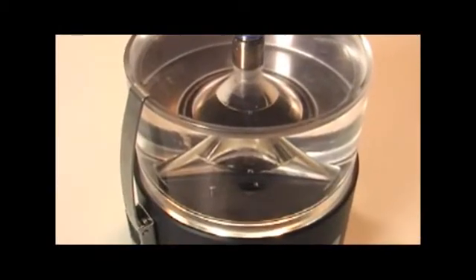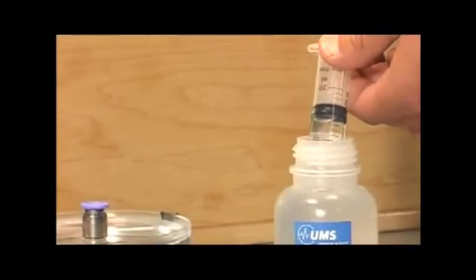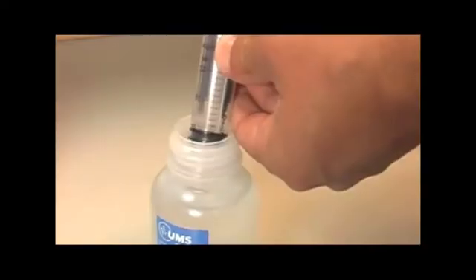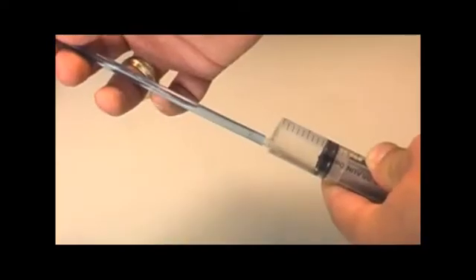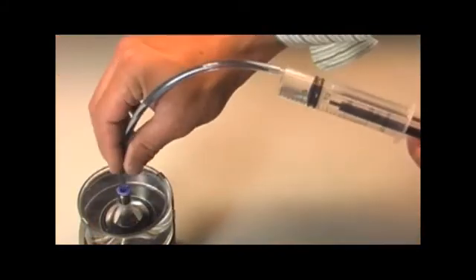The acrylic chamber is for degassing the water inside the HYPROP. Degas 15ml of water and use a droplet syringe to add it to the inner chamber. Degas 10ml more, then attach and fill the blue tube. Insert the other end of the tube into the acrylic chamber.